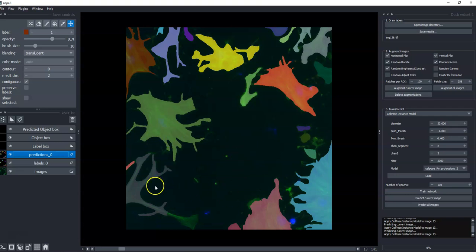But before I do that, I've kind of thrown you into the middle of all this because in my first video, I started talking about the problem, how to organize the data, how to view the data, how to draw labels, annotations. Then I sort of jumped right to a model I'd already trained and showed how to do some predictions and troubleshoot them. But I didn't quite explain how I got to that point of even getting a model. So step back, I'm going to explain that, and then I'm going to take a closer look at this one guy here with the missing piece.